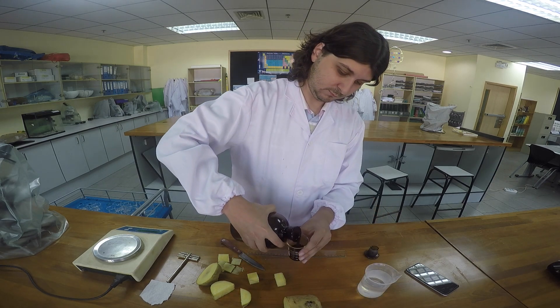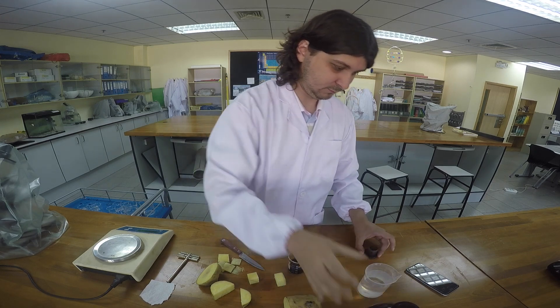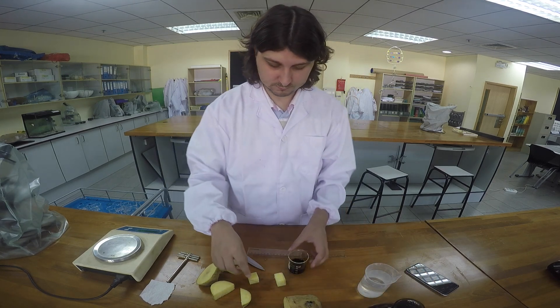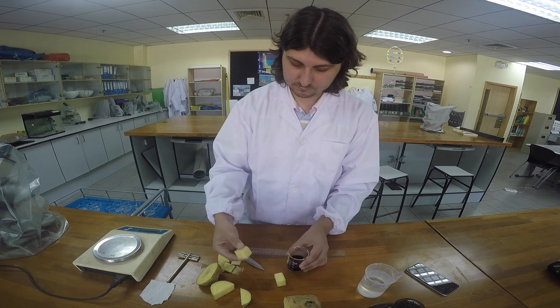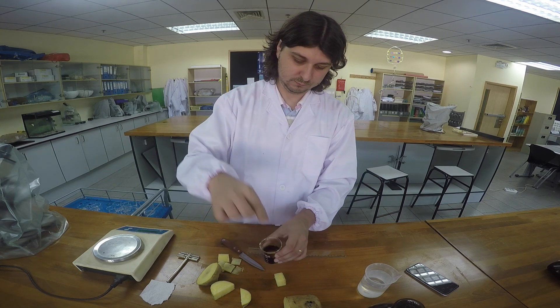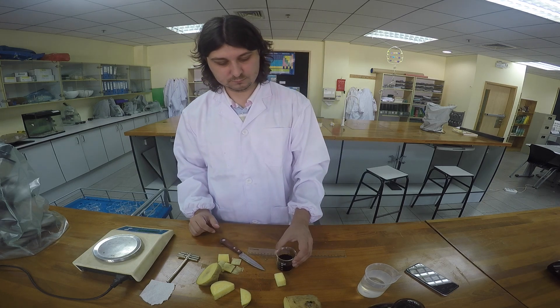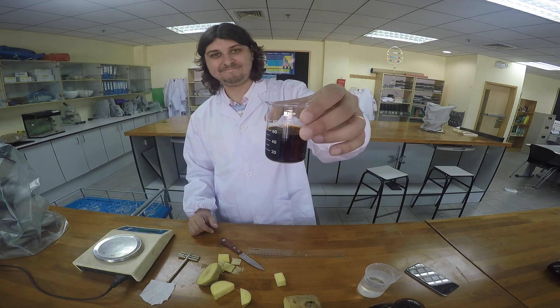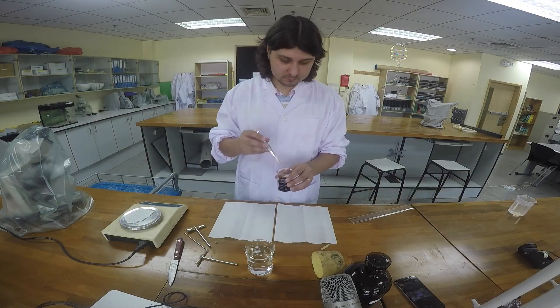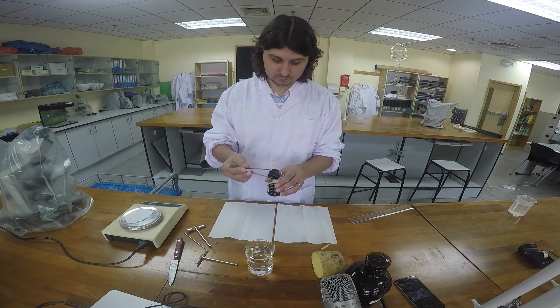You should run the experiment with the small cubes first and collect data while the large cubes are being submerged, thus reducing the volume of iodine required. You should also keep this iodine for the following year or repurpose it to reduce chemical waste. Anywhere between 20 to 30 minutes is sufficient for some of the iodine to diffuse into the potato cubes.